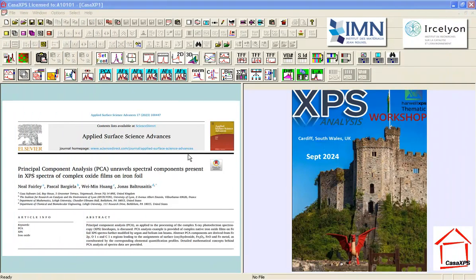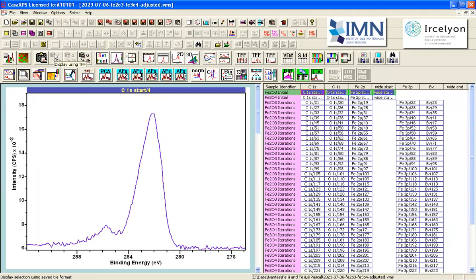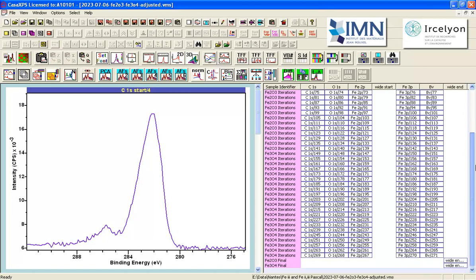In this video, I'm going to look at some data that were collected from two different samples that are presented as pellets formed from Fe2O3 powder and Fe3O4 powder. And the measurements consist of, after initial measurements to investigate what the XPS looks like of these samples, a sequence of iterations, meaning measurements that are identical and are just simply repeated one after the other over a period of time. And this is done for both the Fe2O3 and also the Fe3O4.